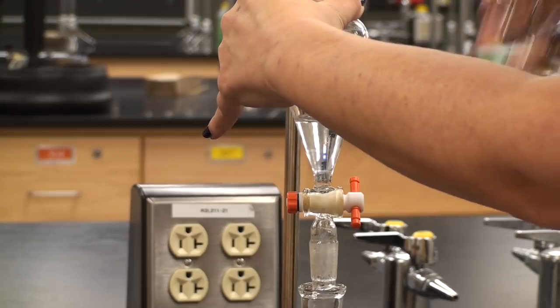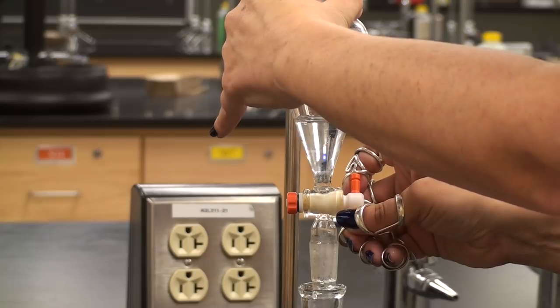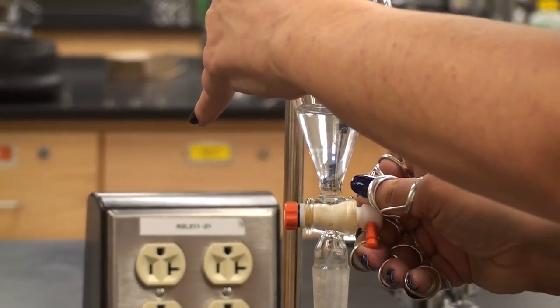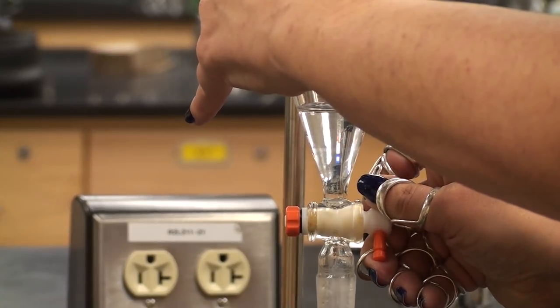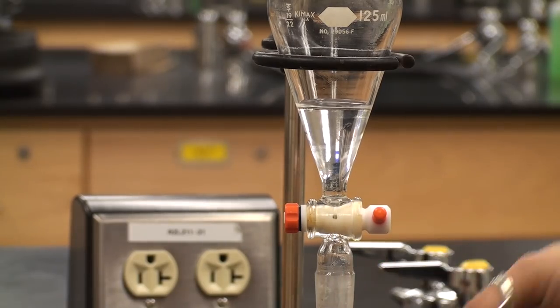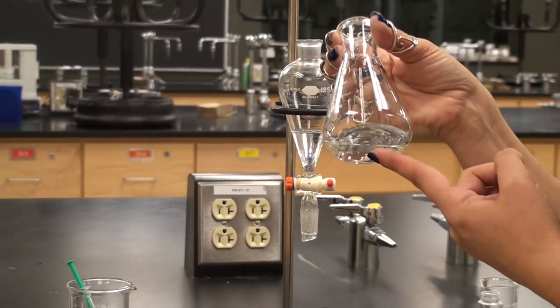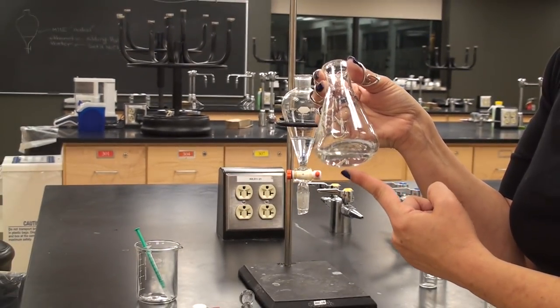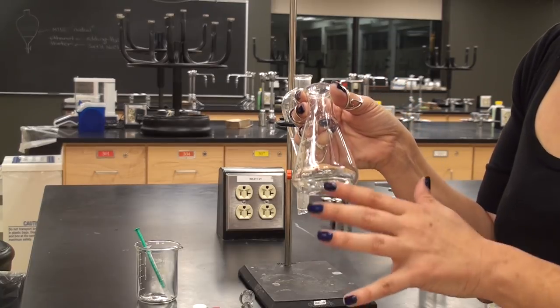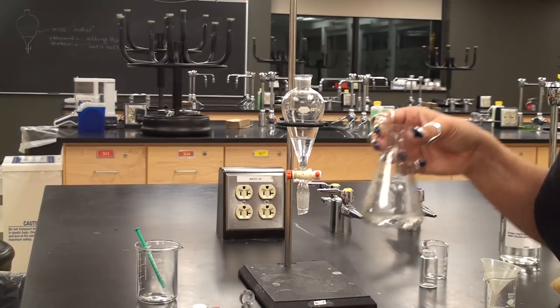Drain until you are just above the stopcock with the organic layer. You now have the aqueous layer — a sodium carbonate solution containing the sodium salt of your acid — in the flask. Do not throw this away; this contains one of your unknowns. Set it aside for now.